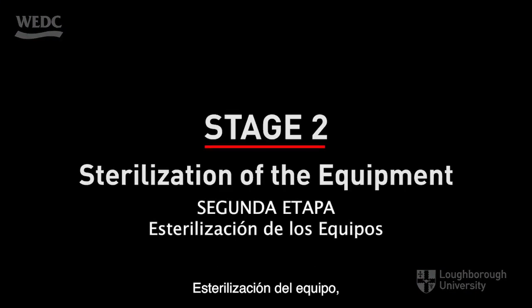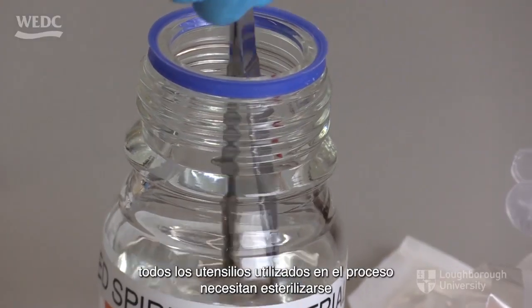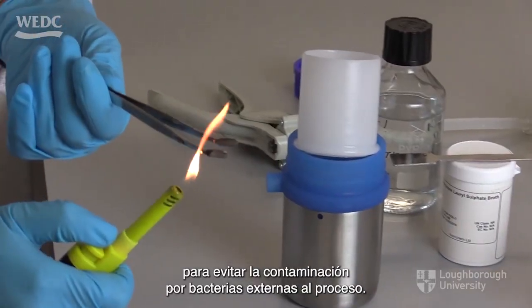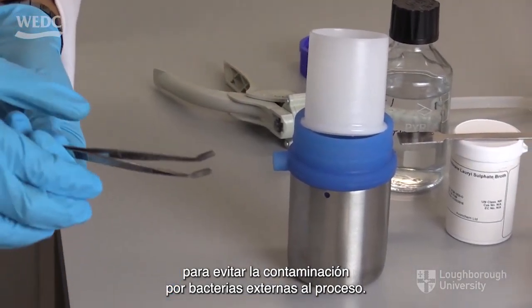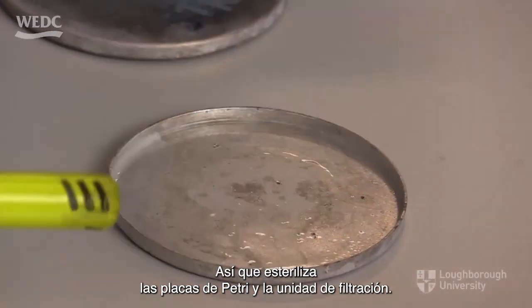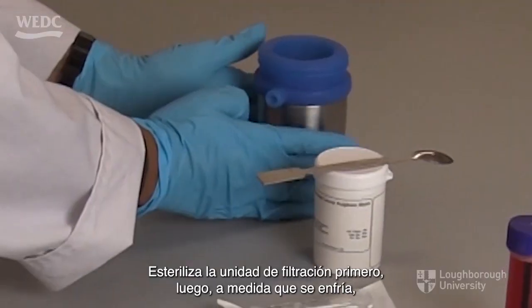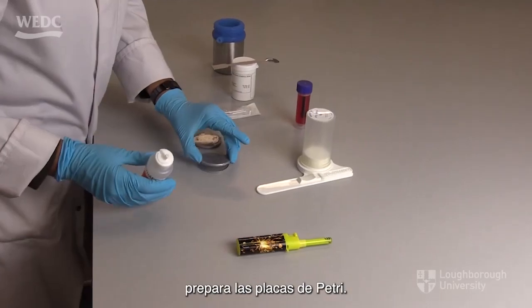Sterilization of the equipment. All utensils used in the process need to be sterilized to prevent contamination from bacteria external to the process. So sterilize the petri dishes and the filtration unit. Sterilize the filtration unit first, then, as it cools, prepare the petri dishes.